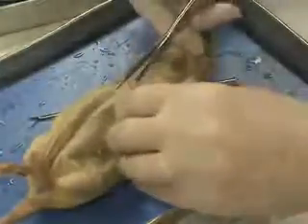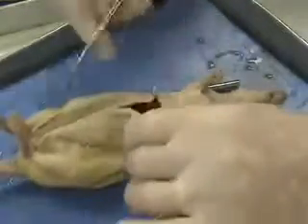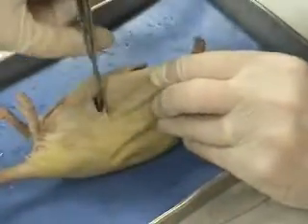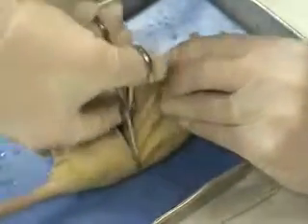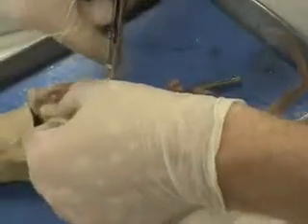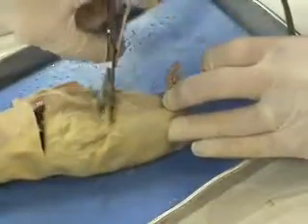I'm also going to make an incision that runs towards the posterior end here, and right about even with the hips, I'm going to work that to the sides too. So we're really just going to make an opening to the abdomen of the rat here. And as I do that, again, I'm going to stay away from cutting too deep. I just want to cut the skin and the muscle so that we can open this area up.